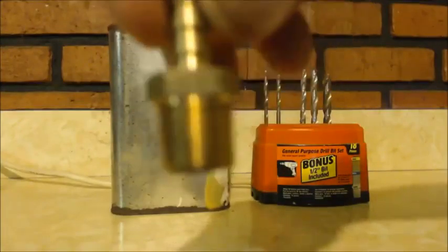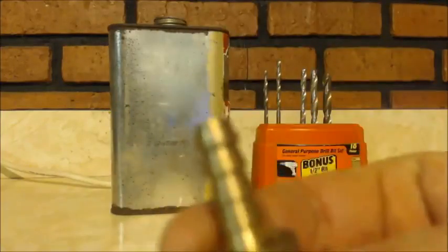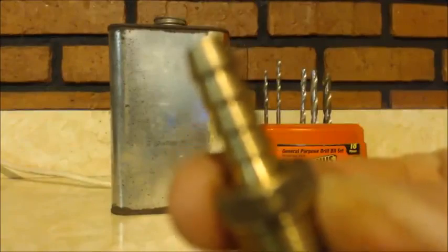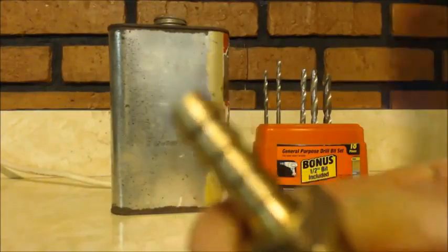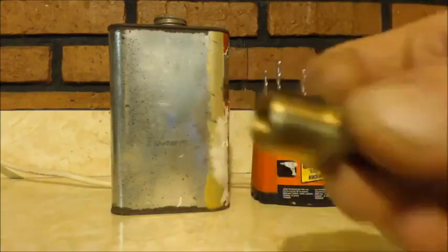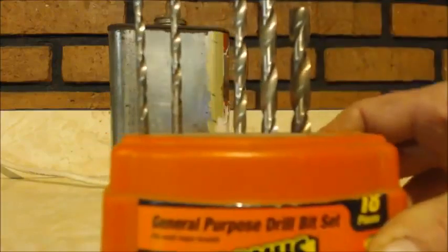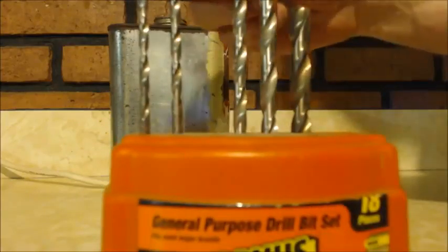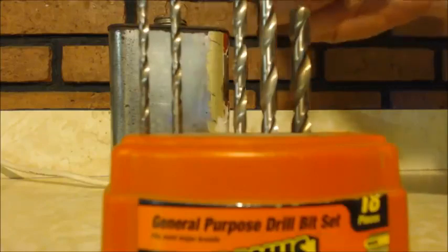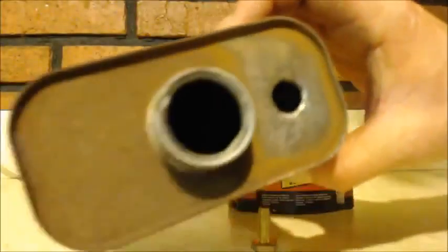See how it has the threads on one side, and on the other side it has the barbed end, like you have on your glass condenser or something. You put a hose on there. So that's a half inch, those threads. What I did was I went through each one of these: 3/16, 1/4 inch, 5/16, 3/8, and then I made it up to a half inch, consecutively making this hole right here.